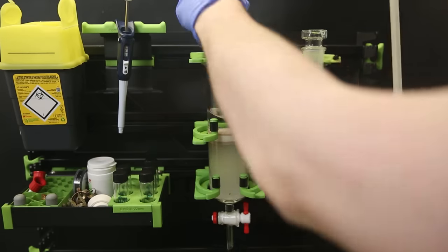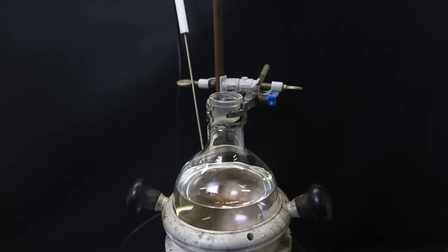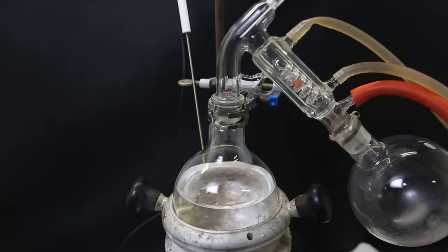Anyhow, I just ran the column normally and then combined all of the solvent that should contain the product, and I just distill it all off again.